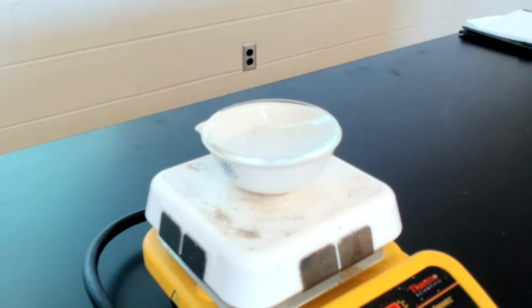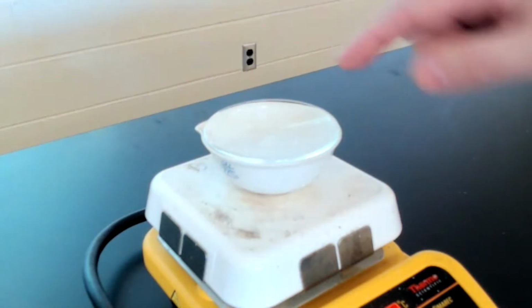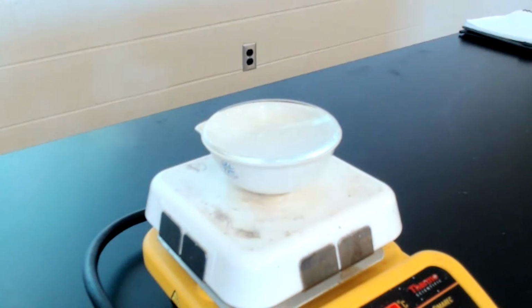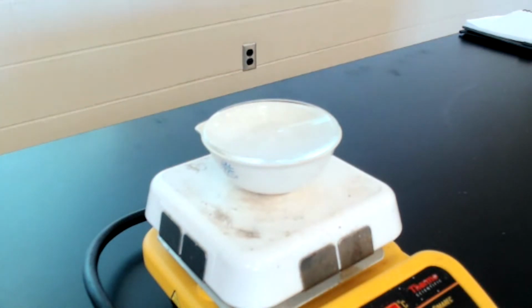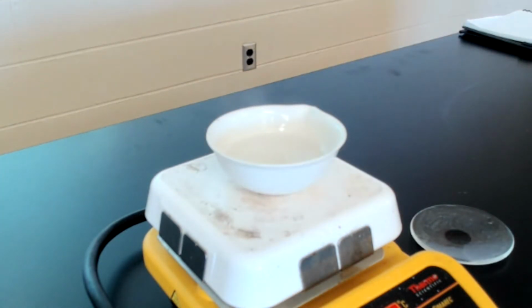So I just want to speak a minute here. So now the solution has passed its boiling point. So you'll notice the steam coming out from over here. I'm not sure how well you can see it. Ooh, sometimes you can see it really well. And then inside of our evaporating dish, we obviously have water evaporating. It is condensing on the top and falling back down. We're going to turn down our heat just a little bit here. So to speed up this process a little bit, I have removed the watch glass from the top.